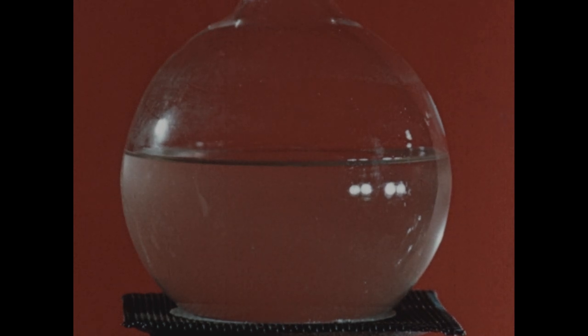We've just seen that some solutes are much more soluble in hot solvents than they are in cold solvents. That is, their solubility increases as the temperature rises. This brings us to a consideration of an interesting phenomenon called supersaturation. In this flask, we've placed quite a large amount of the salt sodium acetate and a relatively small amount of water. Now, sodium acetate is much more soluble in hot water than in cold. So we heated this flask, and all of the sodium acetate dissolved at the higher temperature. Then we very carefully cooled the solution down.